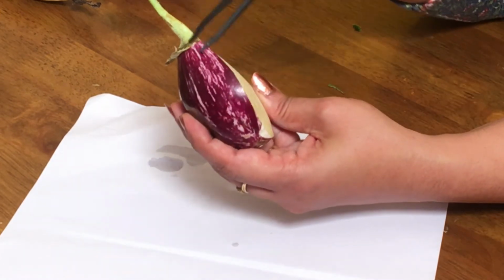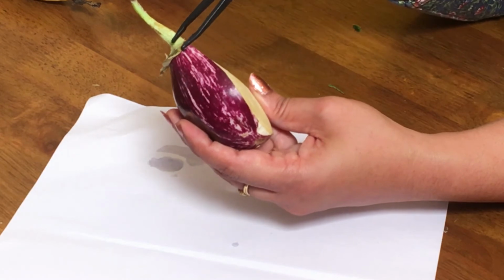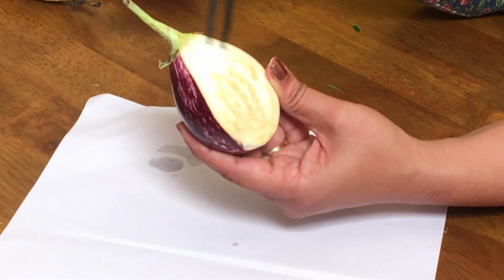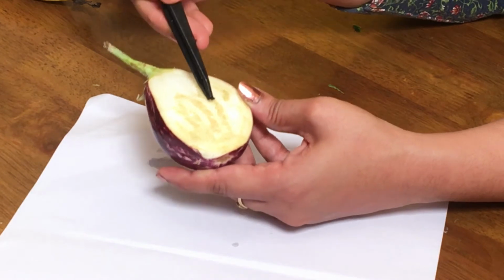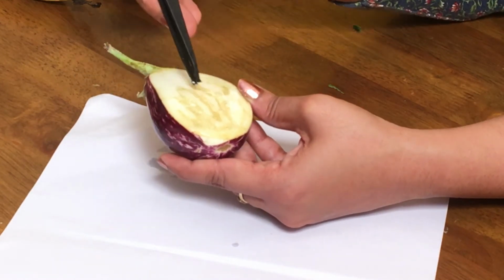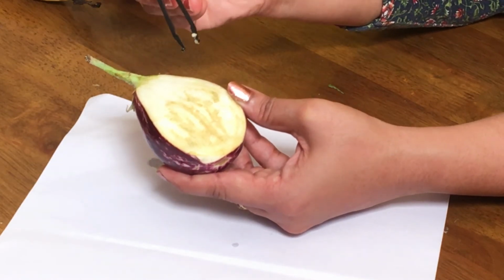The epicarp is this violet, shiny, thin region. This cushion-like part which is soft and fleshy is the mesocarp, and inside you will be able to find the endocarp on which the seeds are placed. So here you can find a lot of seeds of brinjal. The seeds are placed very close to the endocarp, and the seeds are very tiny.